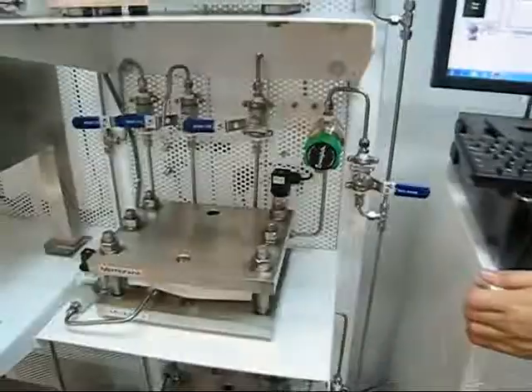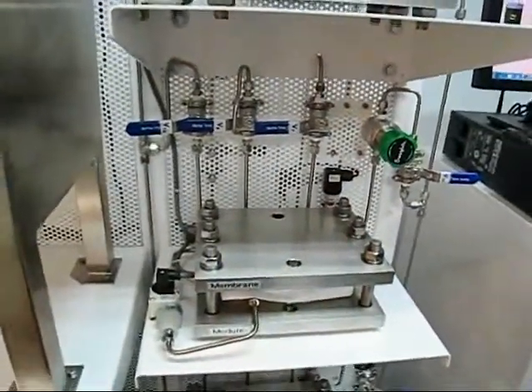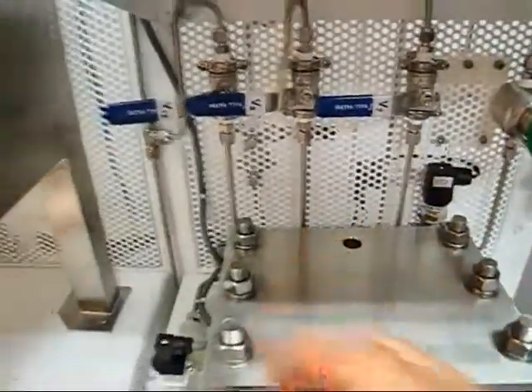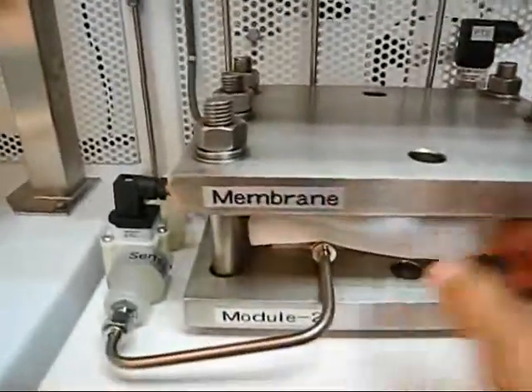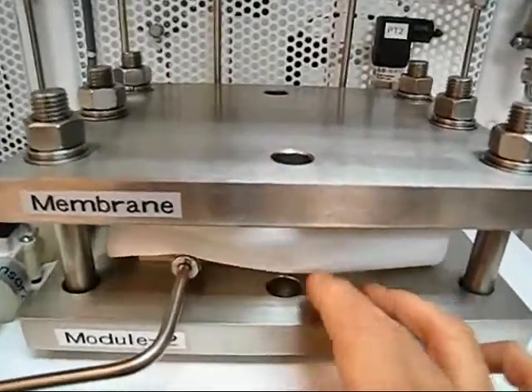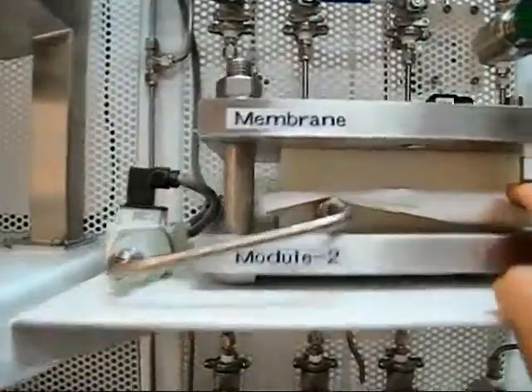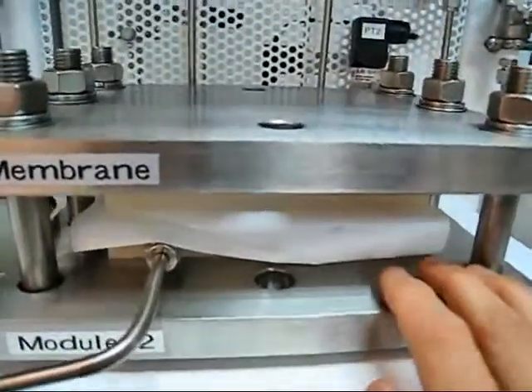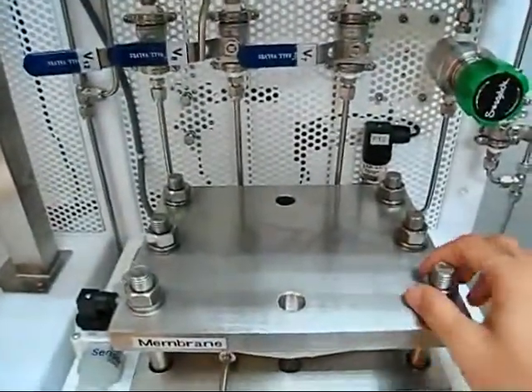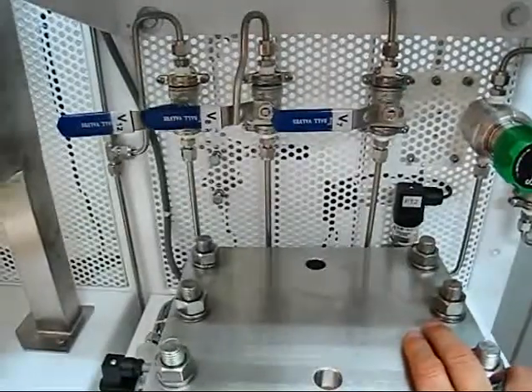Welcome back. I'm about to run the second step experiment. We have opened up all six nuts and loaded the membrane inside here. We're going to test the NF-2 membrane. We have tightened this piece of membrane.